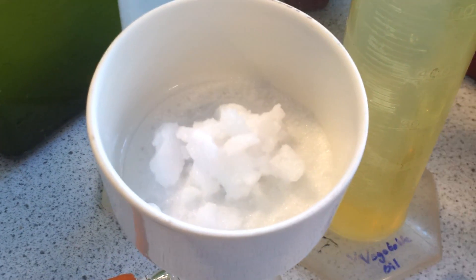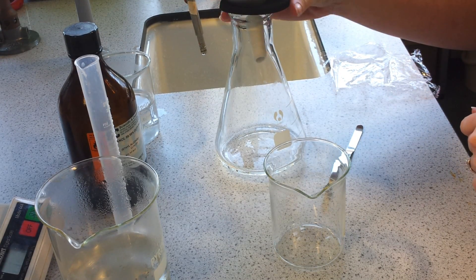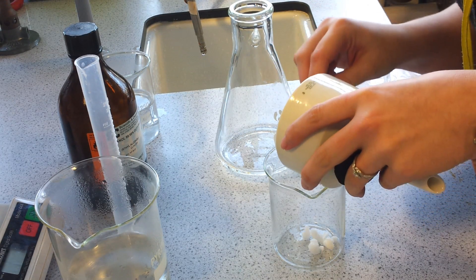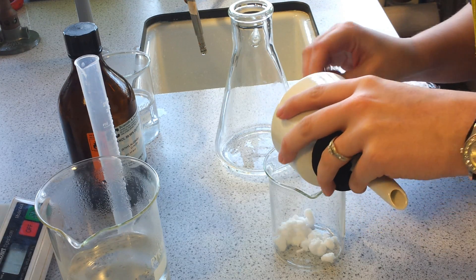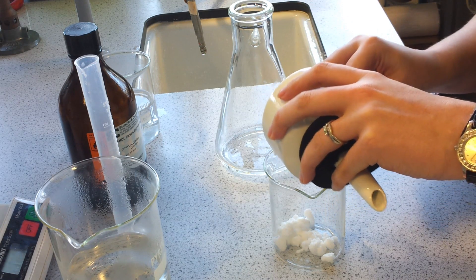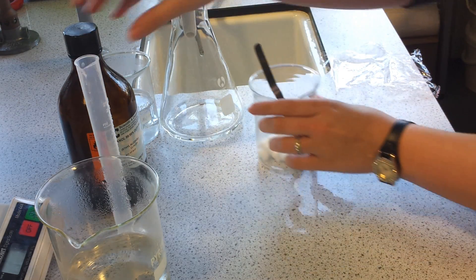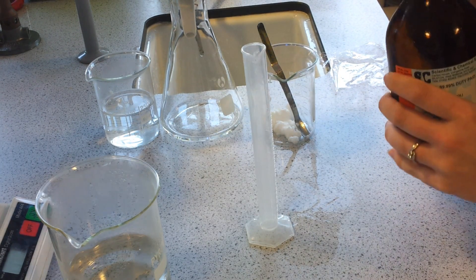The cold water through the Büchner filter cleaned off any impurities. Now we're going to perform recrystallisation on our aspirin, so we're going to take the crystals out of the Büchner filter and into a flask. We will add 10ml of ethanol.